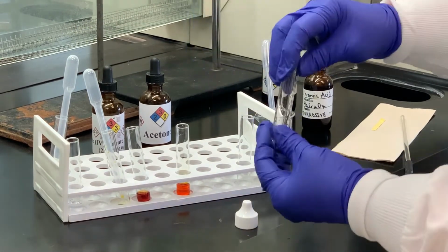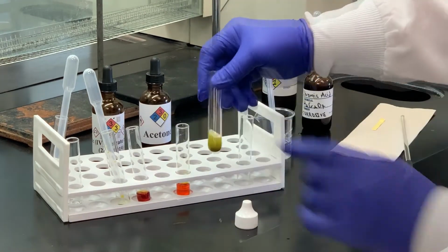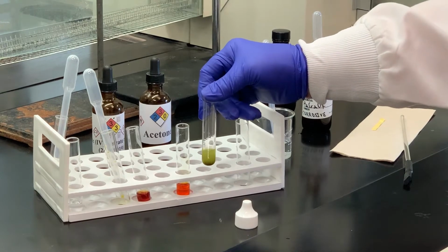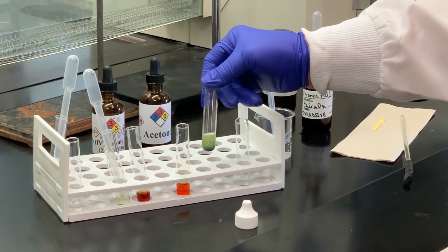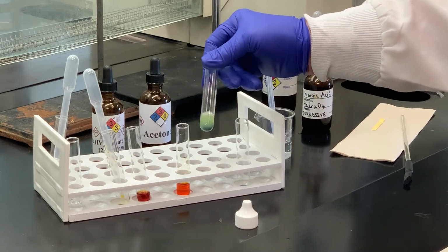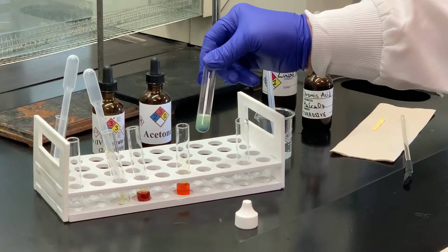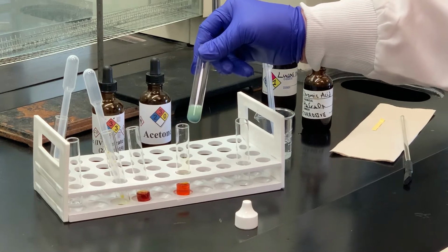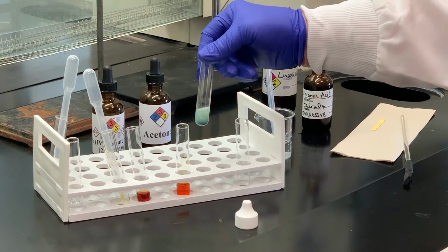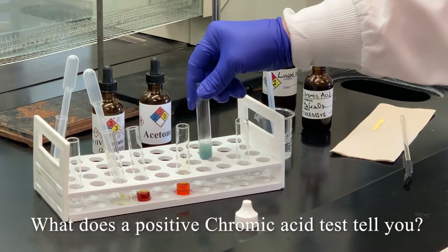And then I'm going to take a drop or two of the chromic acid reagent. And if you notice, the orange color disappeared and we have that kind of bluish green precipitate. One thing about the chromic acid test, you should not really go back and look at any results for the chromic acid after 15 minutes. So if something hasn't changed within 15 minutes, don't go back and look at it. But that would be positive.